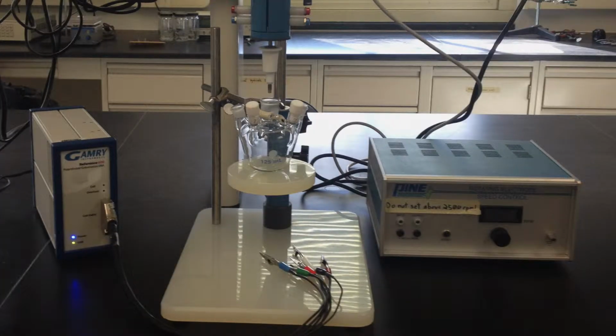In this video, we will demonstrate how to perform corrosion potential measurements and how to use the techniques linear polarization resistance and linear sweep voltammetry to estimate the corrosion current of a steel sample. Here, we will again use the RDE to control the hydrodynamics of a test solution in contact with the metal sample. For our tests, we will be estimating corrosion properties of a steel sample in an aerated acidic solution.